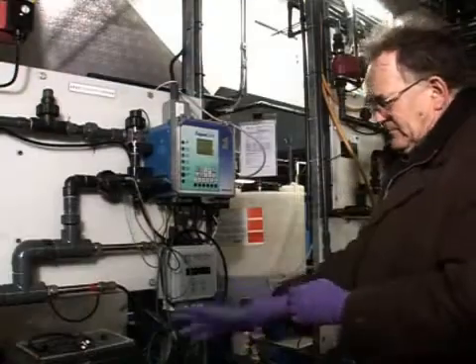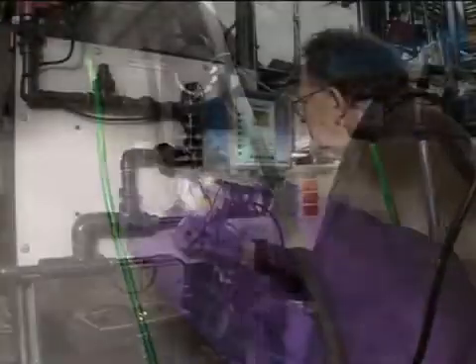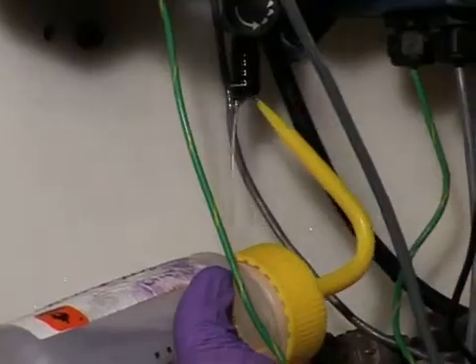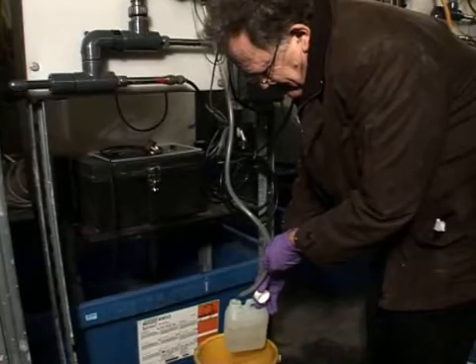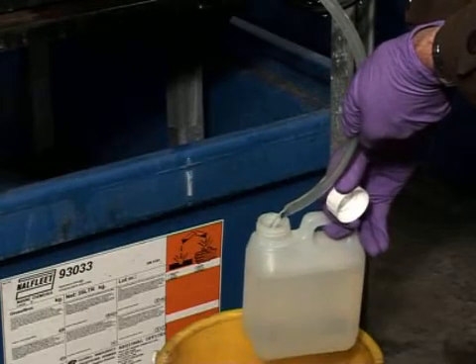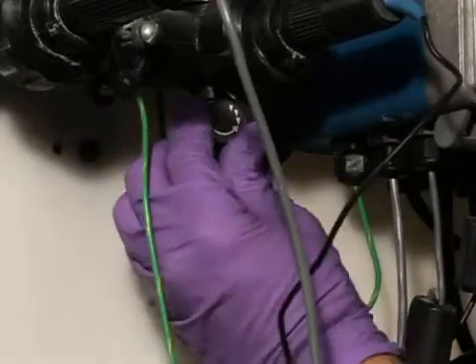There should be a sample tap on the pipe returning the water to the tower distribution system. This is the water that is most likely to contain Legionella. Flush the tap and disinfect before collecting a post-flush sample. If pressure is high, water can come out in a spray. Control with a length of clean sterile tubing on the tap to feed the sample into the bottle and by opening the valve a minimal amount.